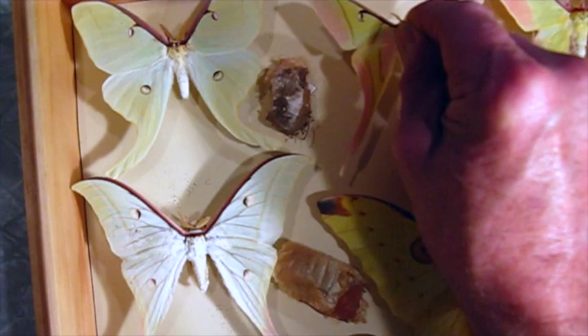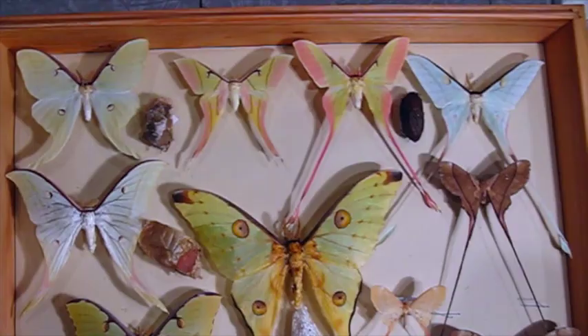So comparatively, this one is really nice — it's in beautiful condition. We'll just put that in here. Oh yeah, that's going to look really great. It looks very much like the Dubernardi color-wise, but it's really distinctive. Look at that — it's beautiful.